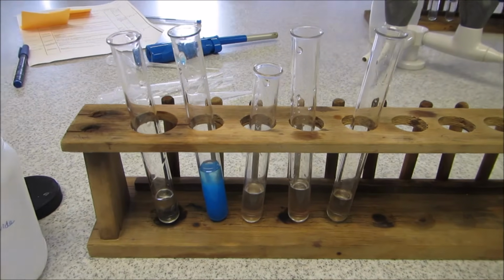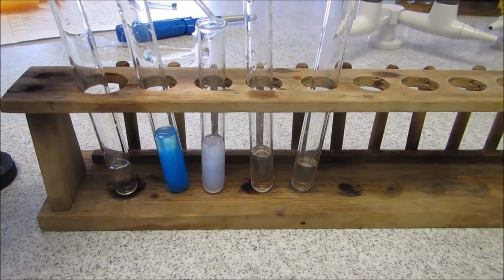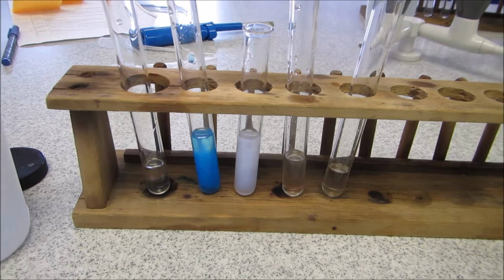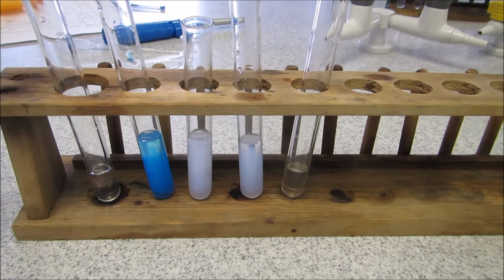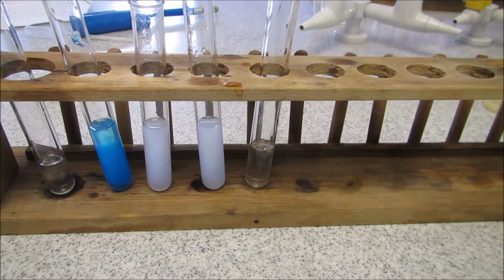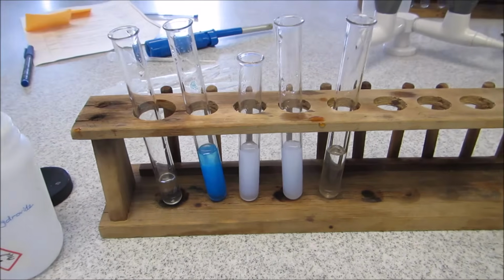So the first one, what did you observe? The second one, again, what did you observe? Same with the third. Because some of them form white precipitates that are insoluble in excess sodium hydroxide, I'll just add more. So this one has also got a precipitate. I'll add some here. And finally to the last one. Based on those reactions, you should be able to narrow down the cations to a certain degree.